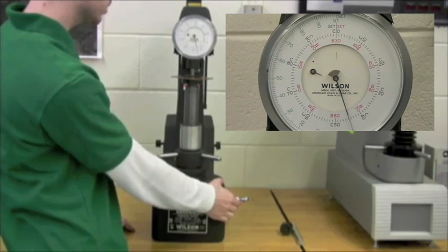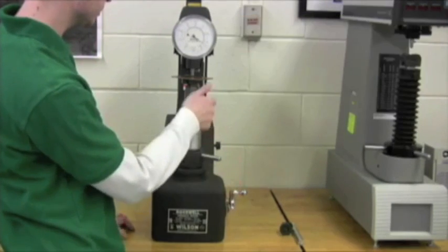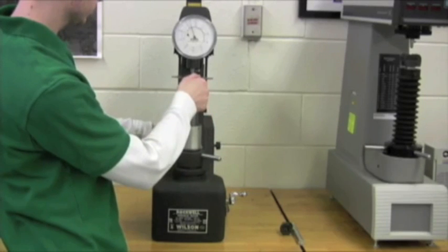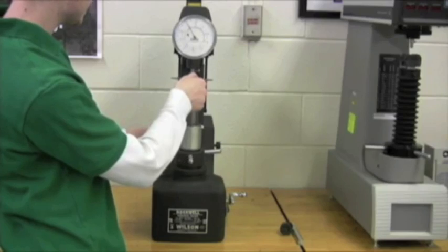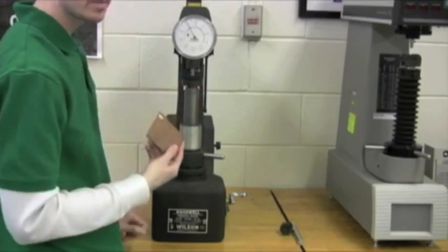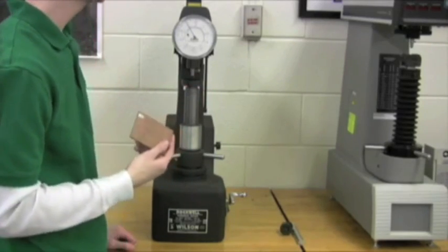So we're going to release our crank handle one more time before we take it out. Loosen it up. And that is our test. We're going to want to make sure that we do this another two times.